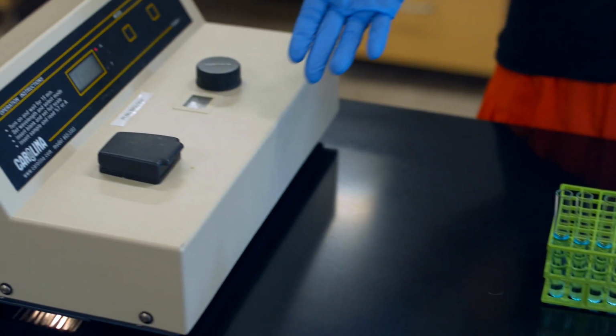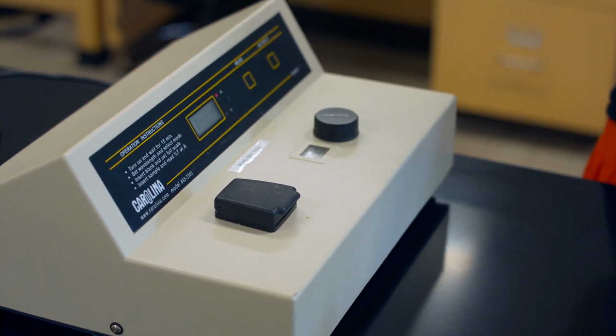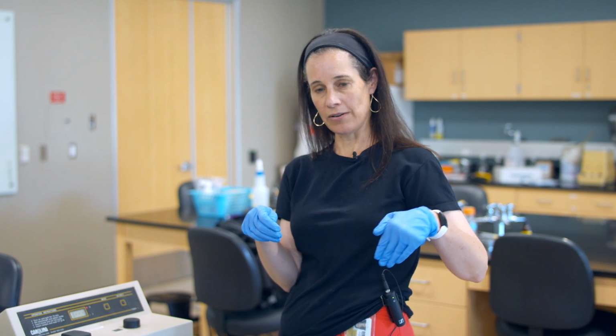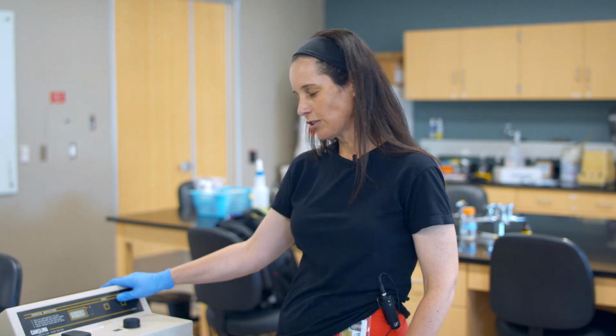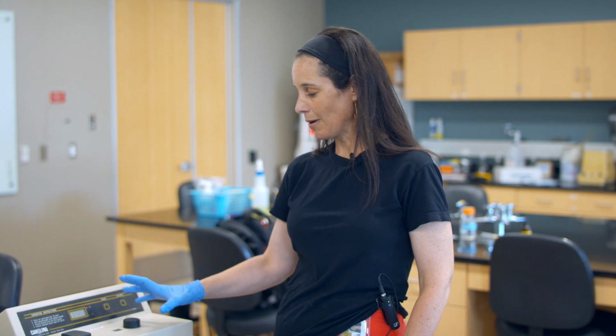What a spectrophotometer does is it's going to shoot a ray of light through your sample. So as your concentration goes up, the absorbance of light will go up and the transmittance will go down. So the first step, what you're going to want to do on a spectrophotometer is set it to the appropriate wavelength. This is a common mistake for students. They just come up to a spectrophotometer and they don't adjust the wavelength for that particular substance that they're looking at.